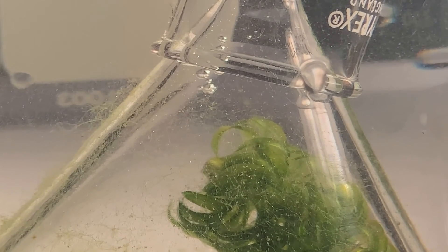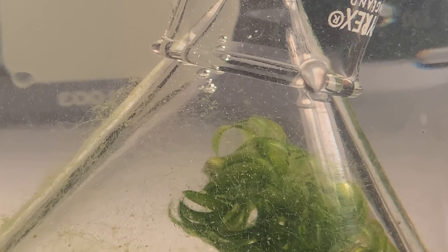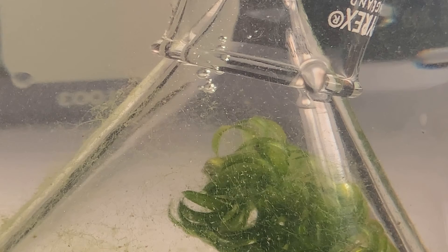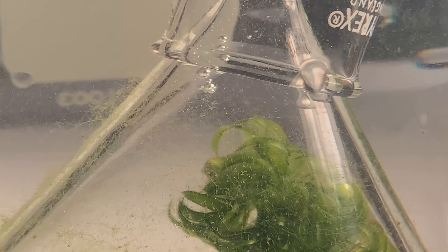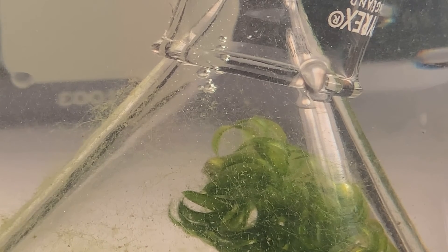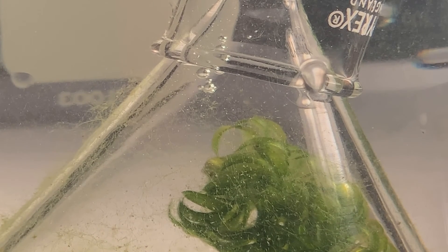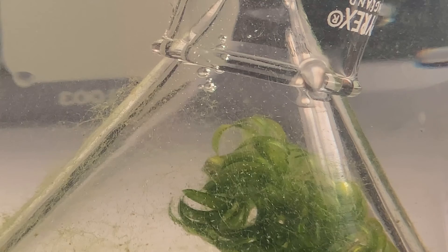This plant is 10 centimetres away from the lamp. Count the number of bubbles produced in 30 seconds, double this, and record it in your results table.